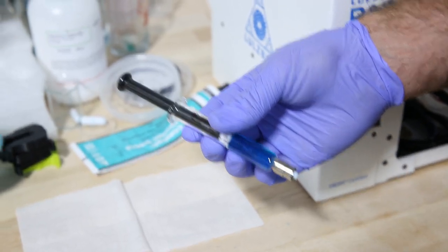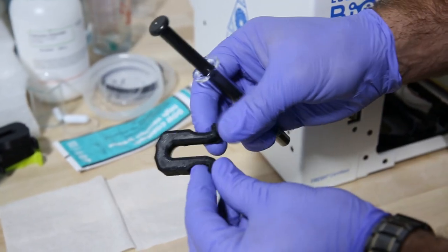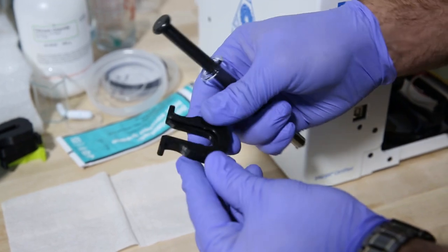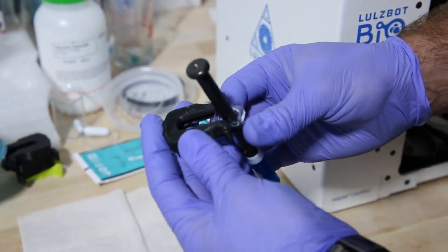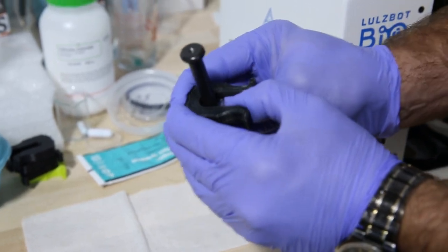Now we're gonna add our syringe collar to our syringe. You'll see on the syringe collar there's a skinnier section and a wider section. The skinny section goes towards the top of the syringe and you slide it into this slot and it'll click into place.